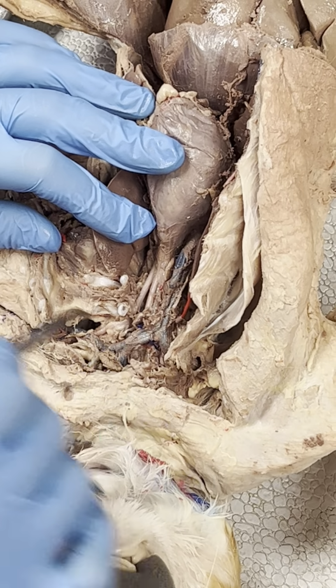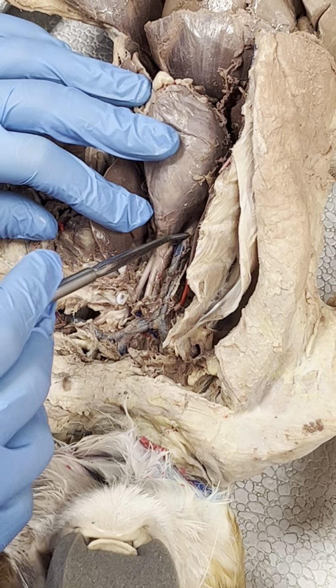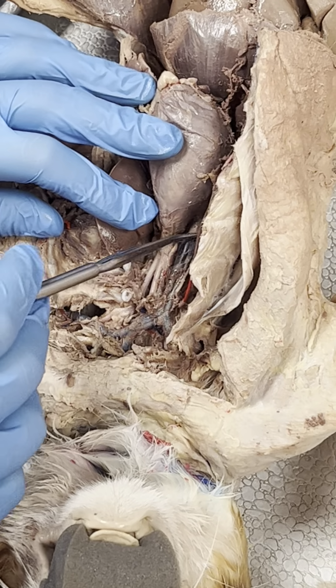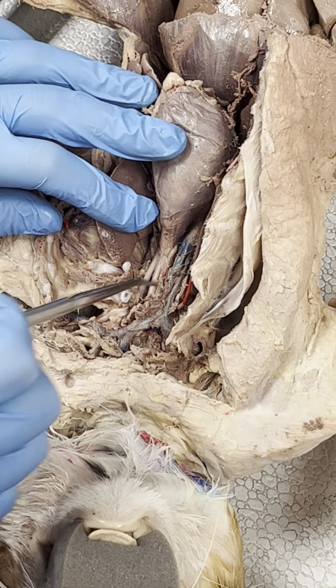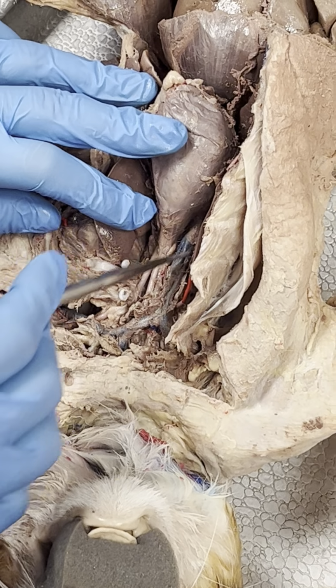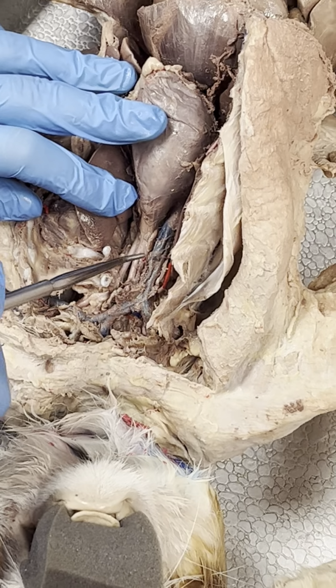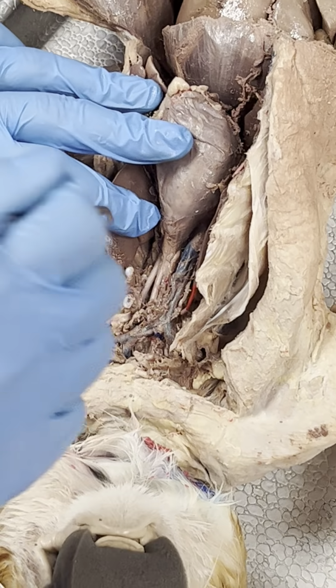This is one that can be a little bit variable depending on the specimen. I've seen some that have a really, really short superior vena cava and the split is all the way down here. And then we've got some where the split is all the way up here. So this is where knowing the branching pattern is going to be a better determinant than knowing specifically where in the chest the pin might be.